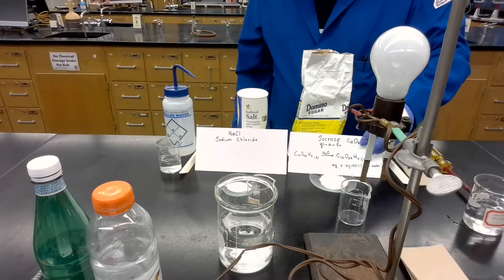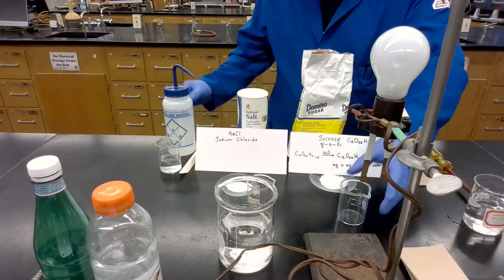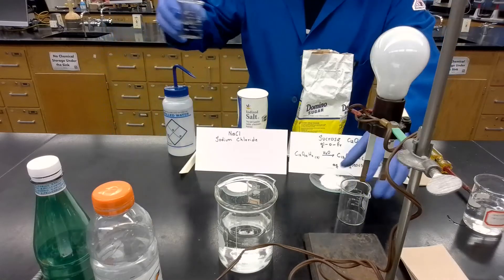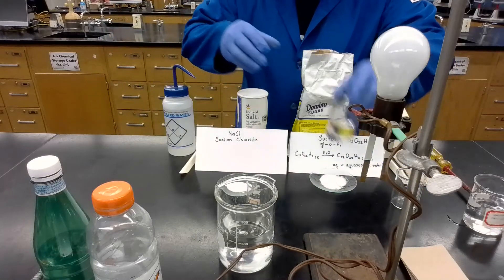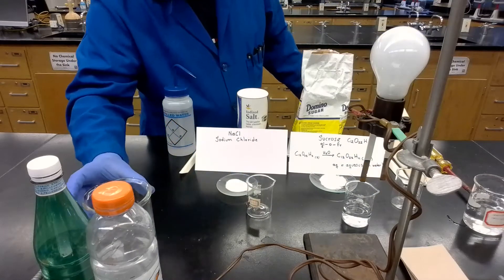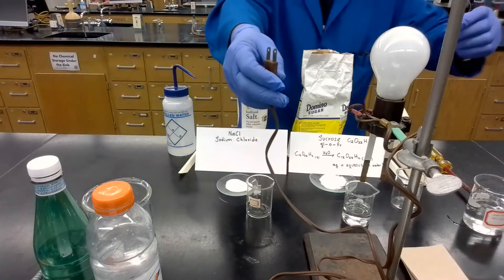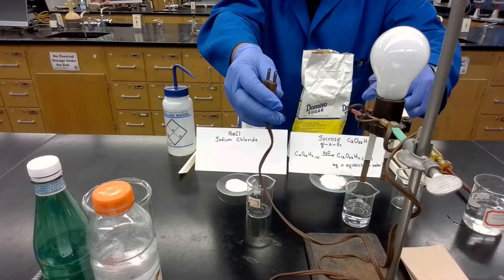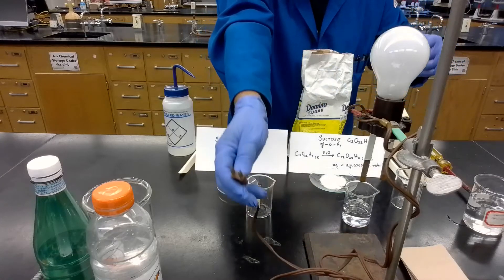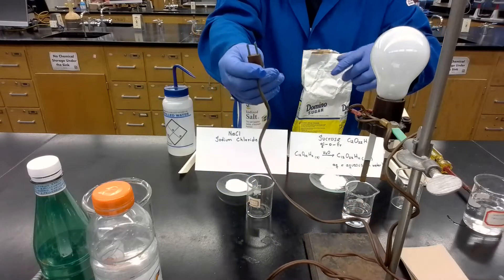Let's test the water first. Let me use the distilled water here, and we are going to test it using this circuit. Let me explain how the circuit works. This is a circuit that contains a light bulb. Normally, when you want to connect a light bulb to the power supply, you use one of these plugs.